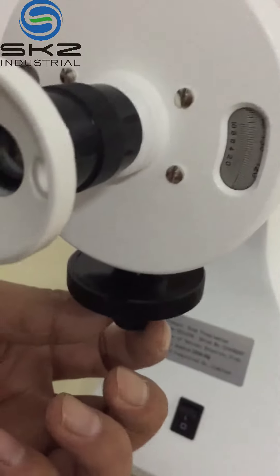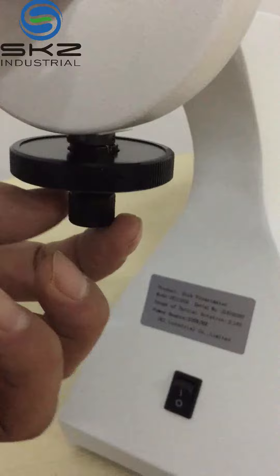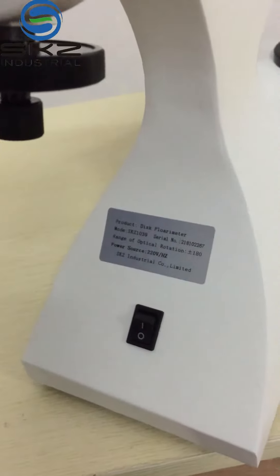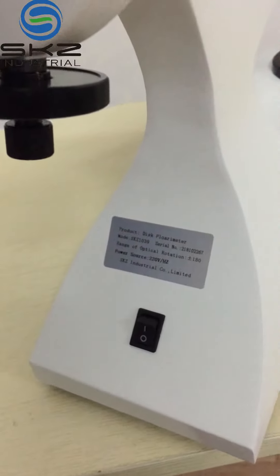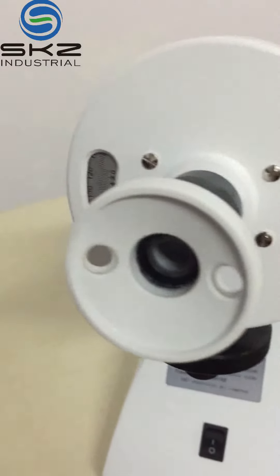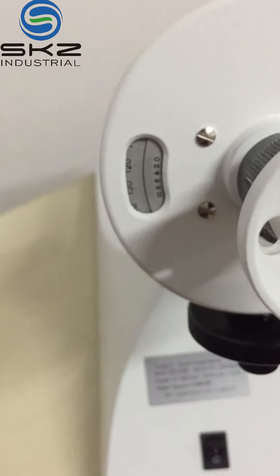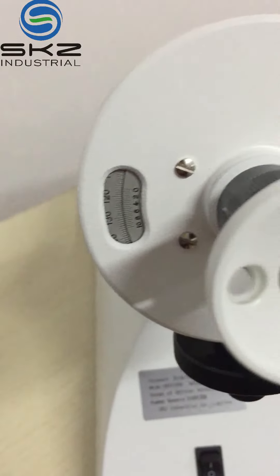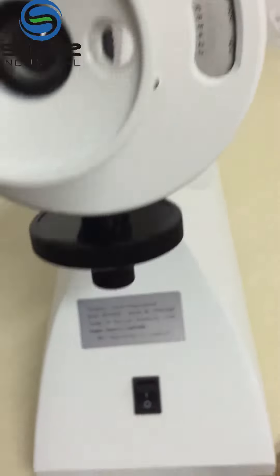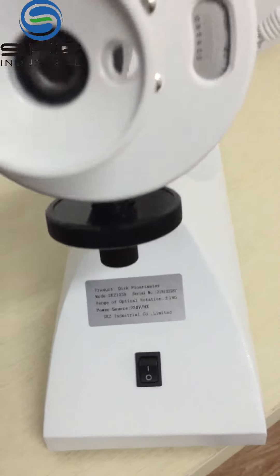In this part, it has object lens, eye lens, magnifying glass. You see here — this part and this part is a dial vernier. Here is a hand wheel for the dial.